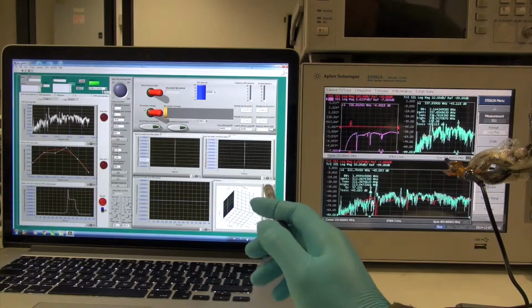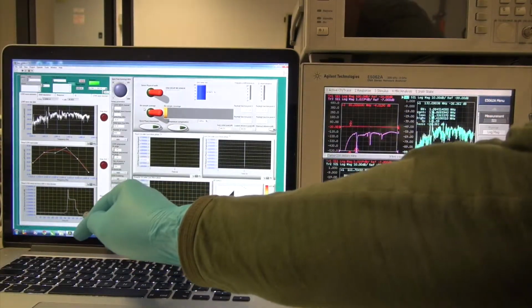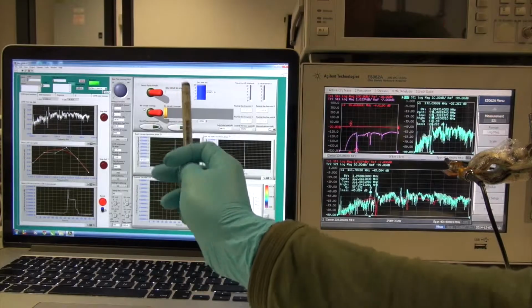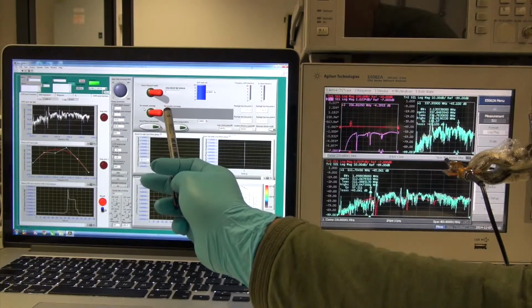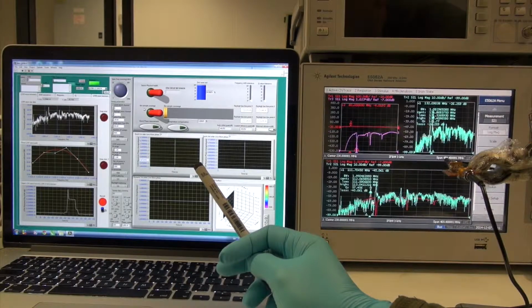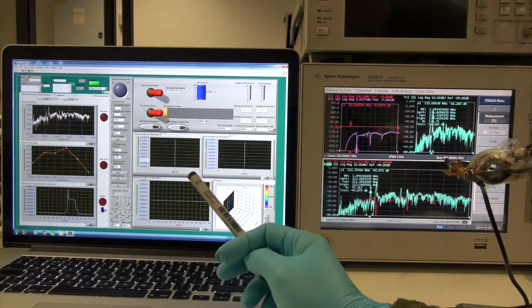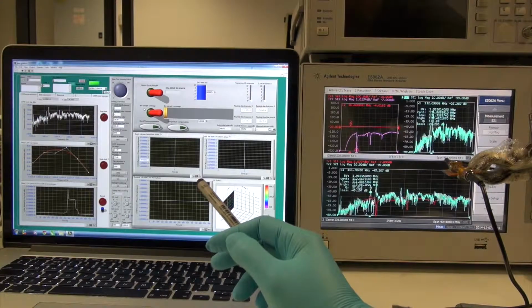So for this specific device, we can see after the Love wave fully recovered, the Rayleigh wave amplitude still didn't 100% recover. That means this device has some dust on the surface because it's not always in a clean environment. It needs a deep cleaning.